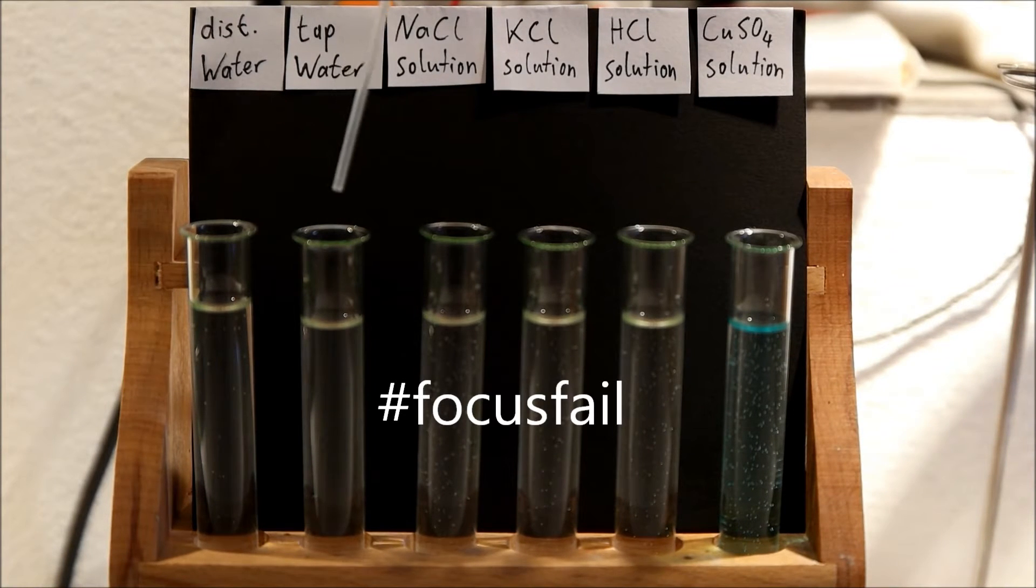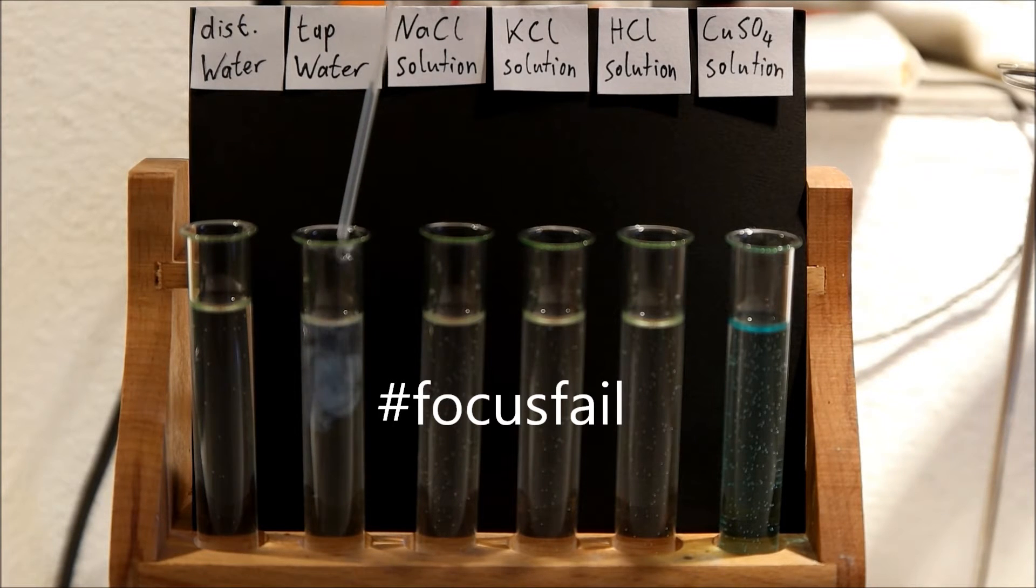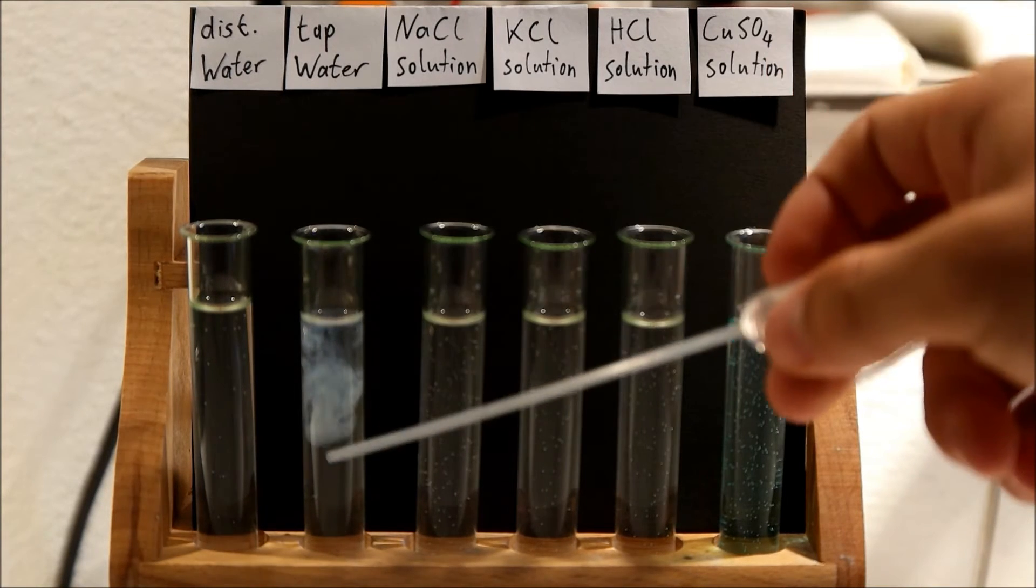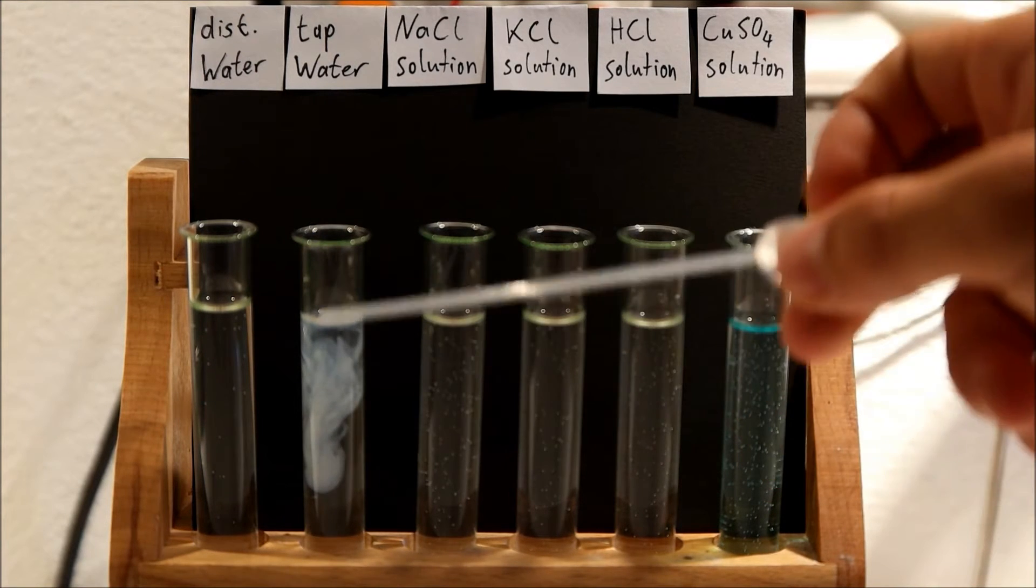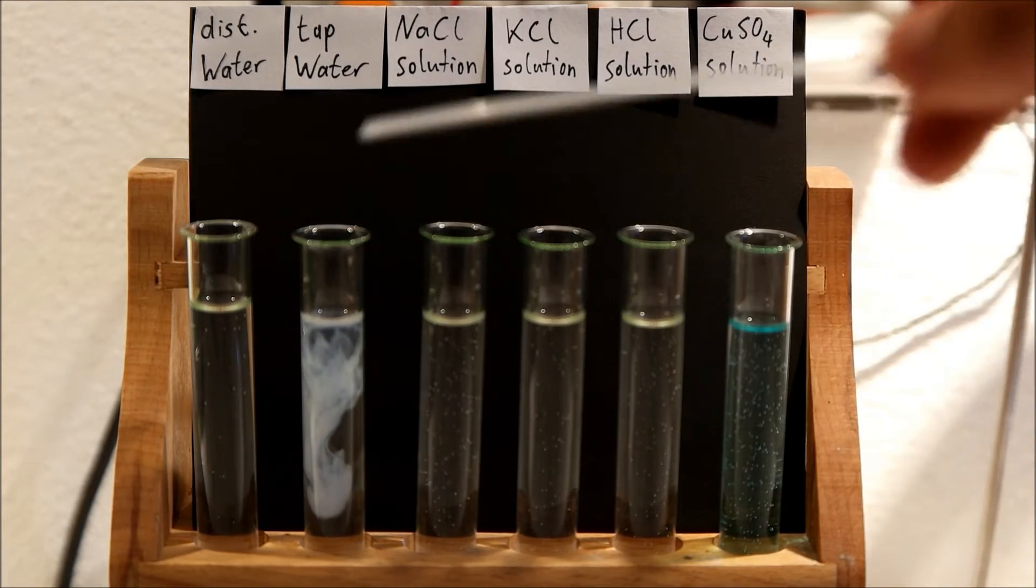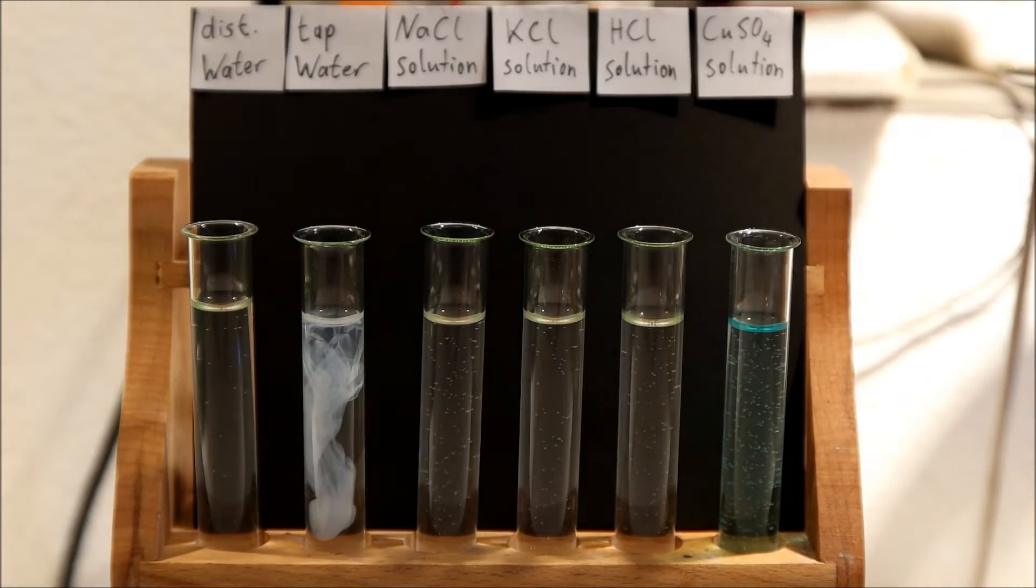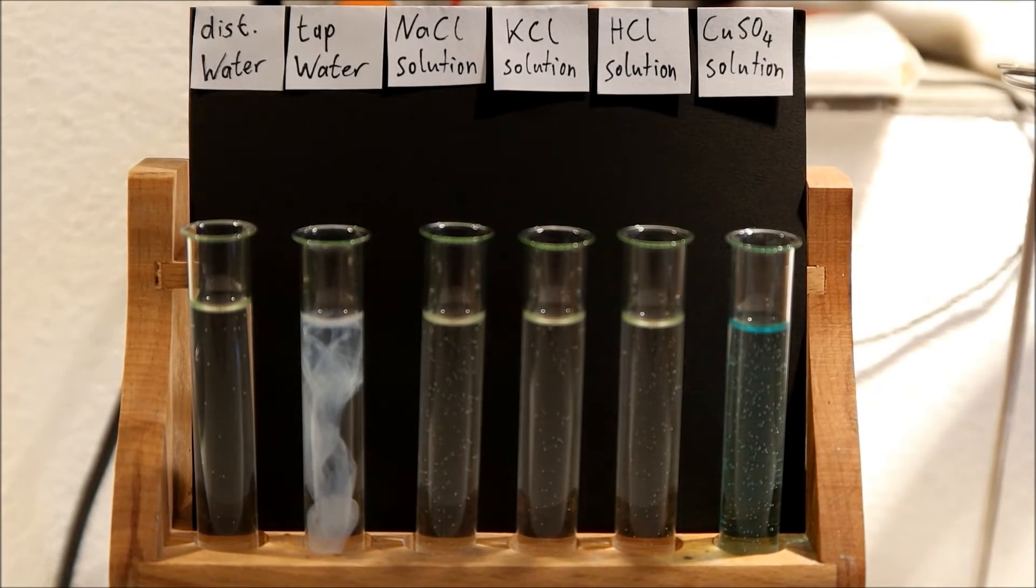But if you try the same thing with tap water, you can see why we call it the precipitation reaction. There is this white precipitation in this test tube.